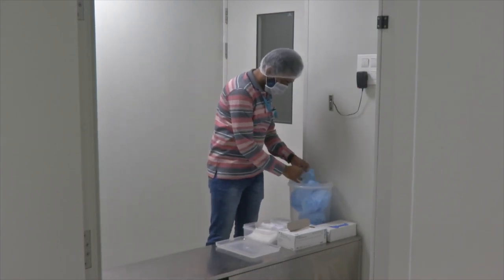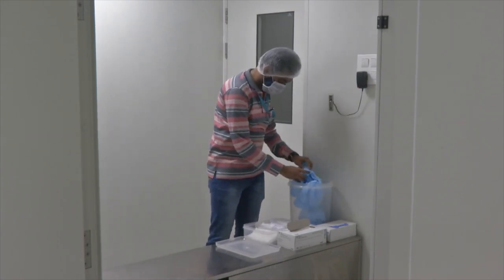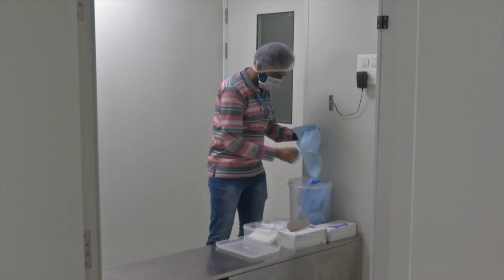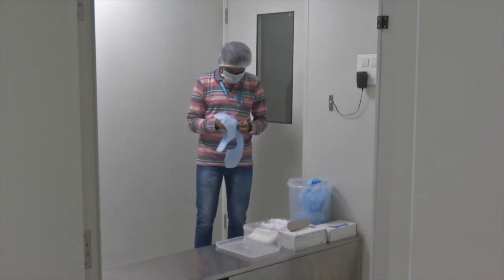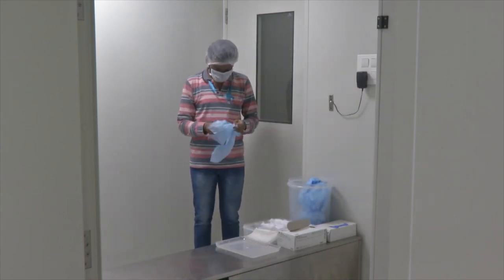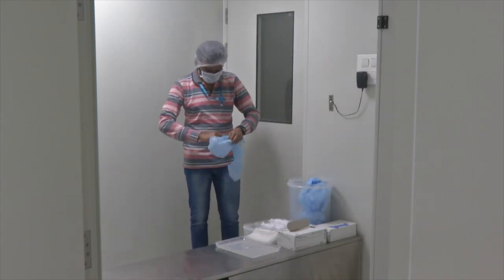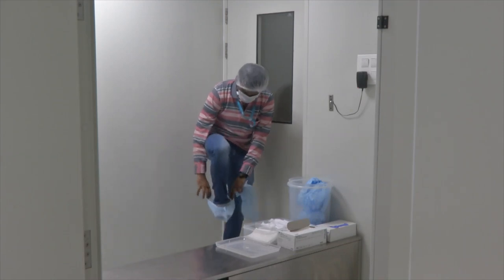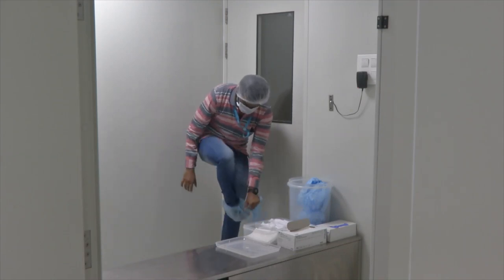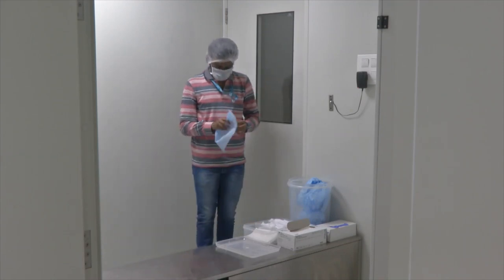The next step is to wear shoe covers. Shoe covers are meant to prevent any kind of dust particles from our feet when we are entering the premise of the clean room.